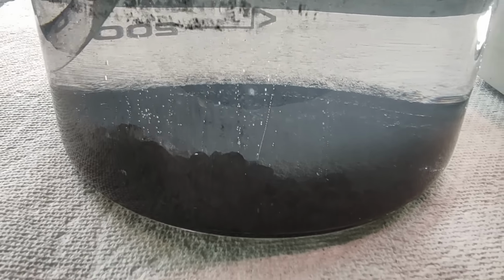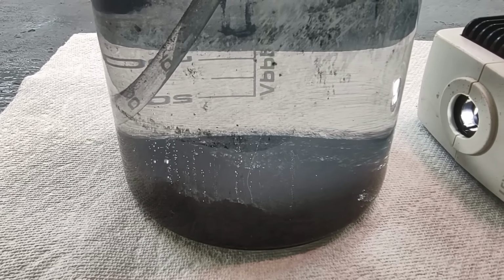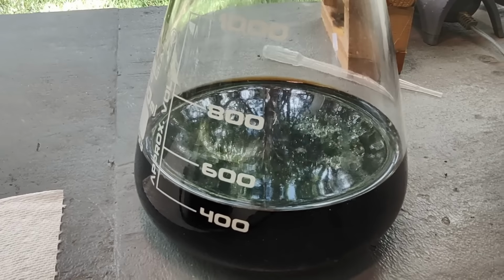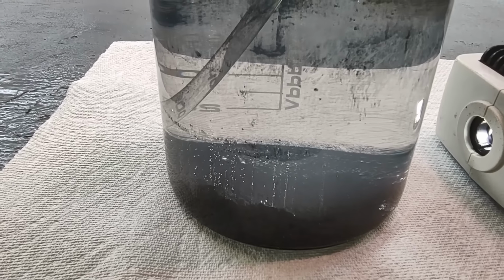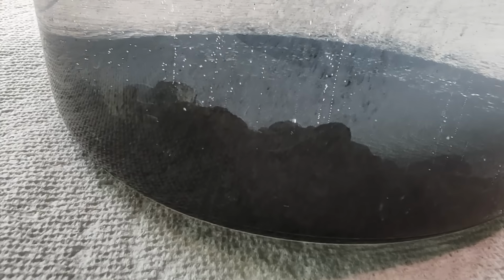Okay, so this is still quite hot. I'm going to let it sit here and cool off, and I'm going to scare up some more ammonia. I'm going to have to go off to the store and buy some so I can do the other half of this liquid. Then we'll have all of our palladium. We can weigh it up, see how much we got. That looks like a good sized pile right there.